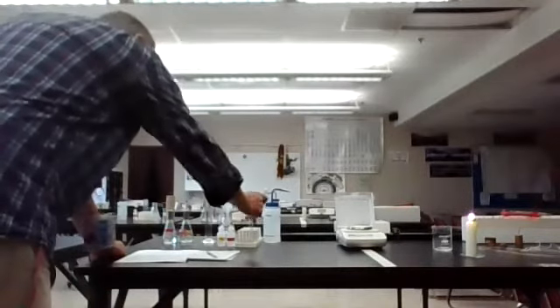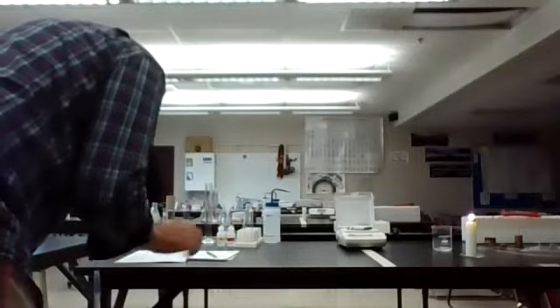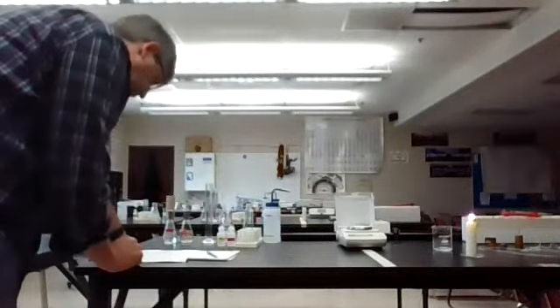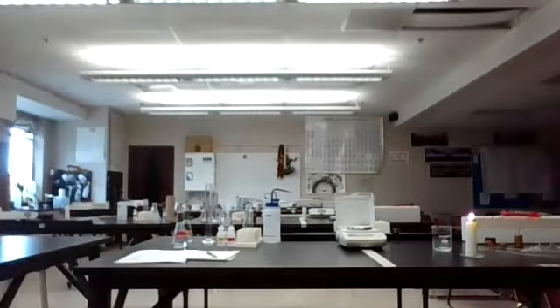The second part, I'm going to get a test tube. Excuse me, I'm going to shut the door so someone doesn't bother us. The second part of this is we're going to get a second piece of magnesium ribbon from my piece of magnesium. And here's our magnesium ribbon. Okay. And then I am going to put 5 milliliters of 1 molar HCl. So the 1 molar HCl is in this. Okay. And I'm going to grab a graduated cylinder.